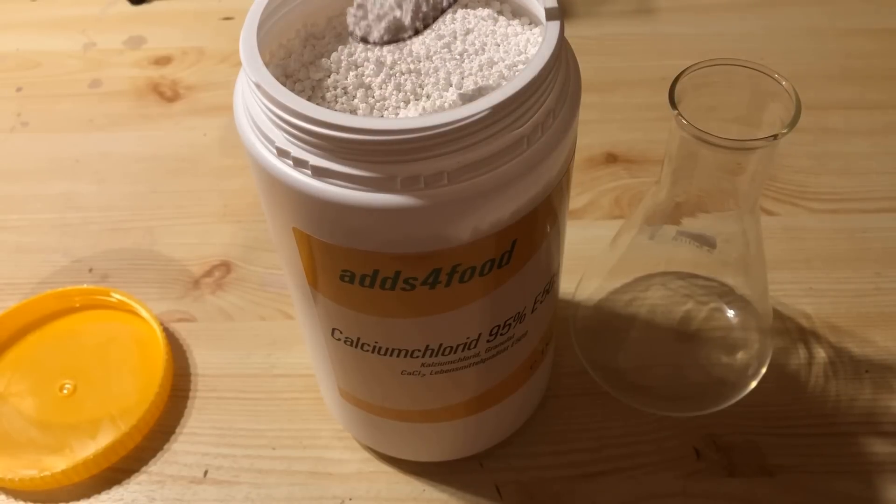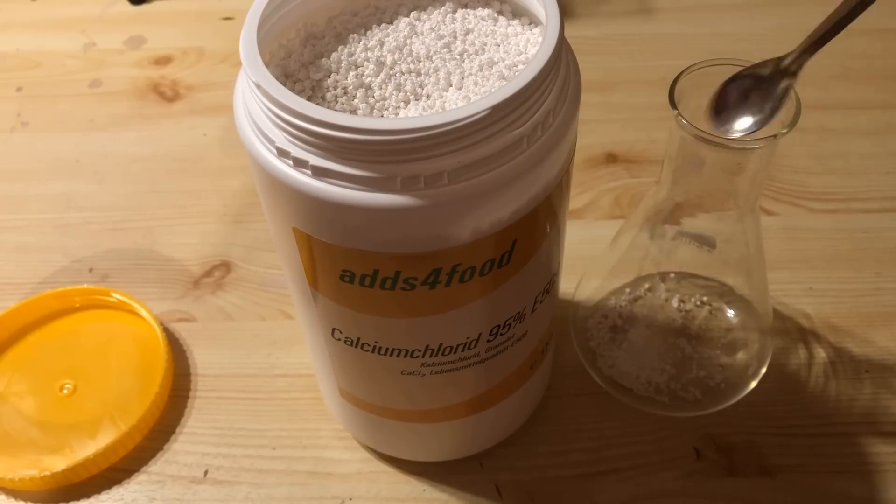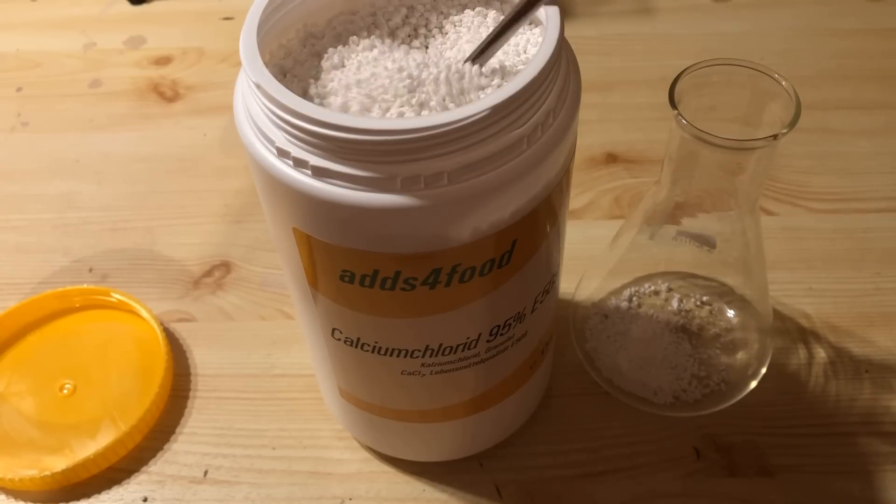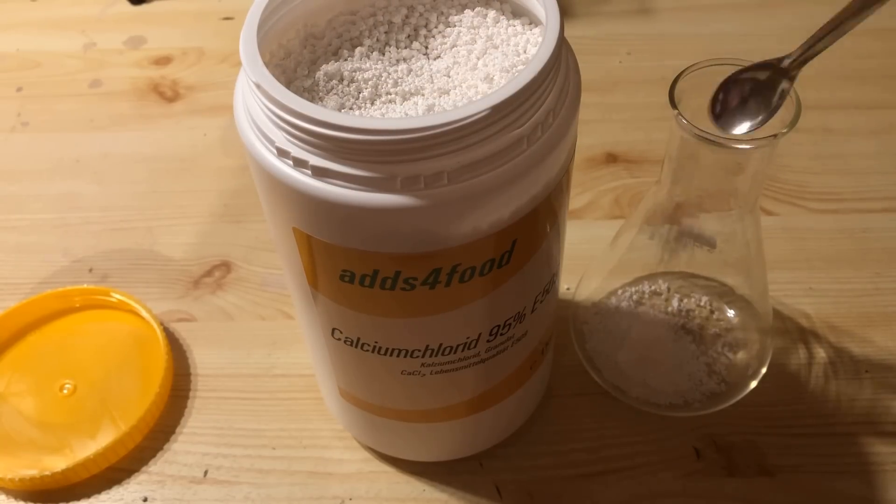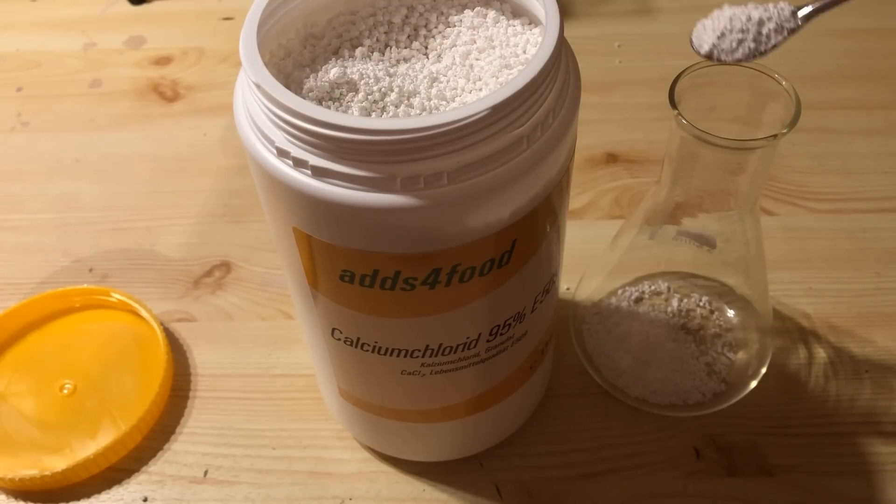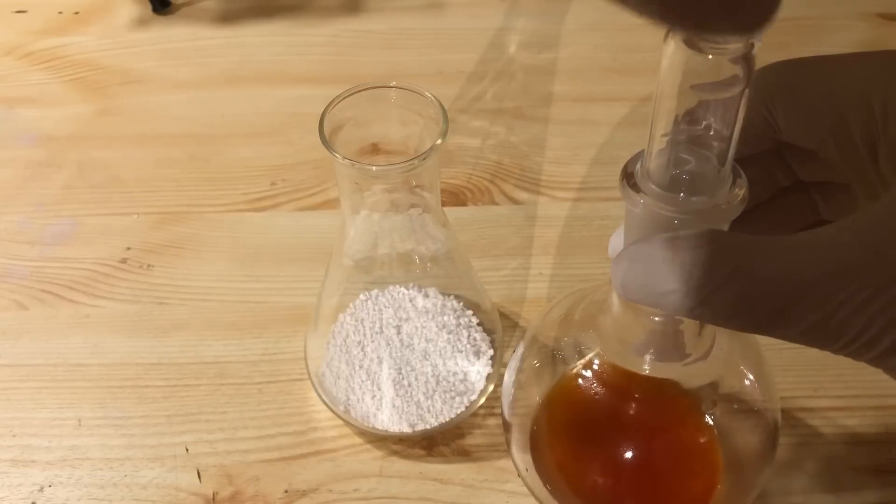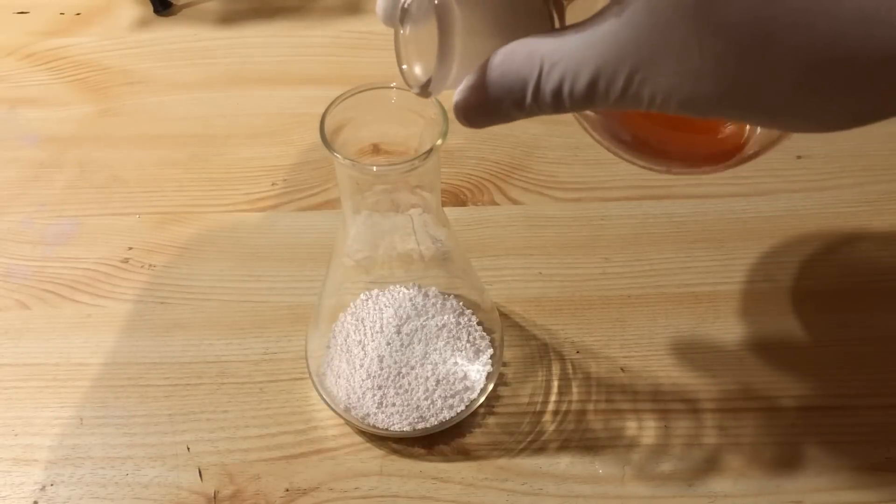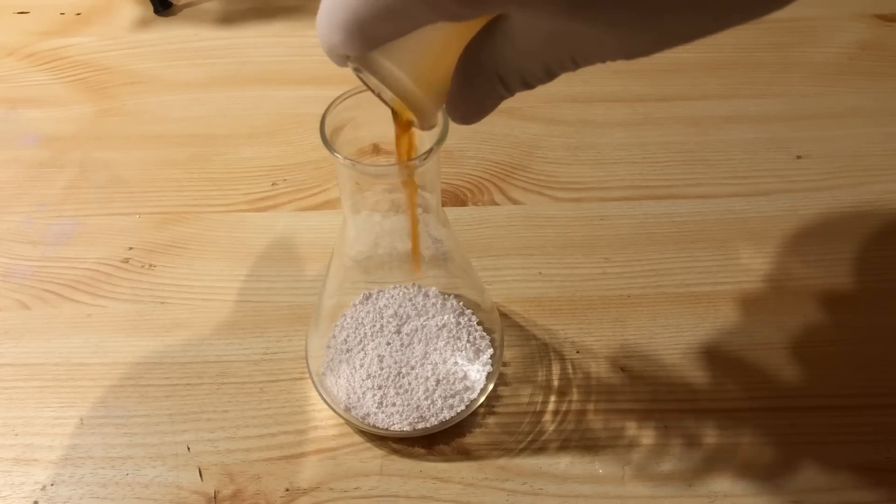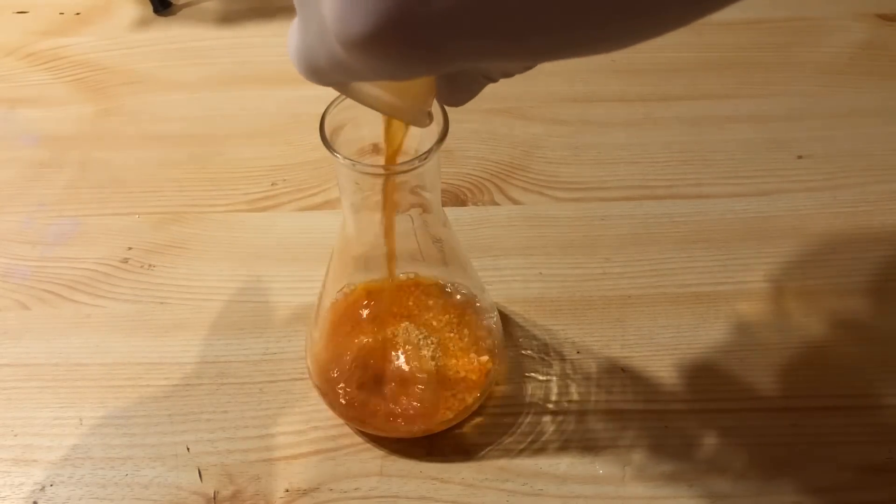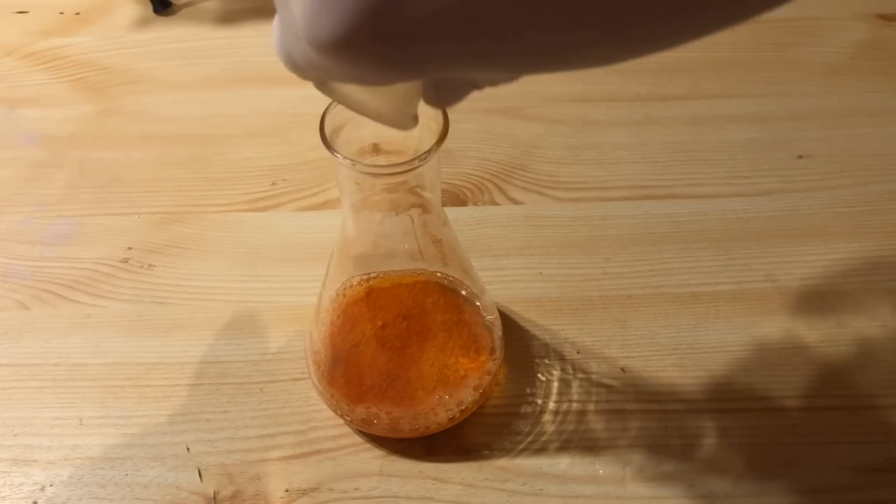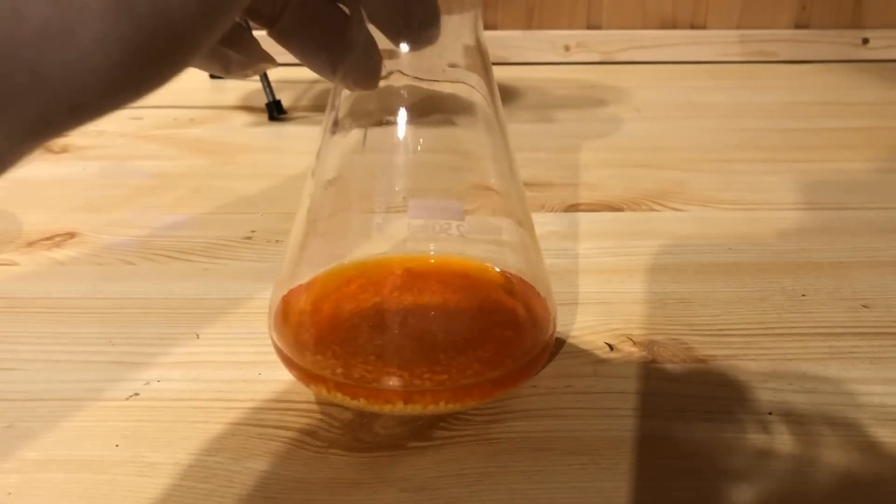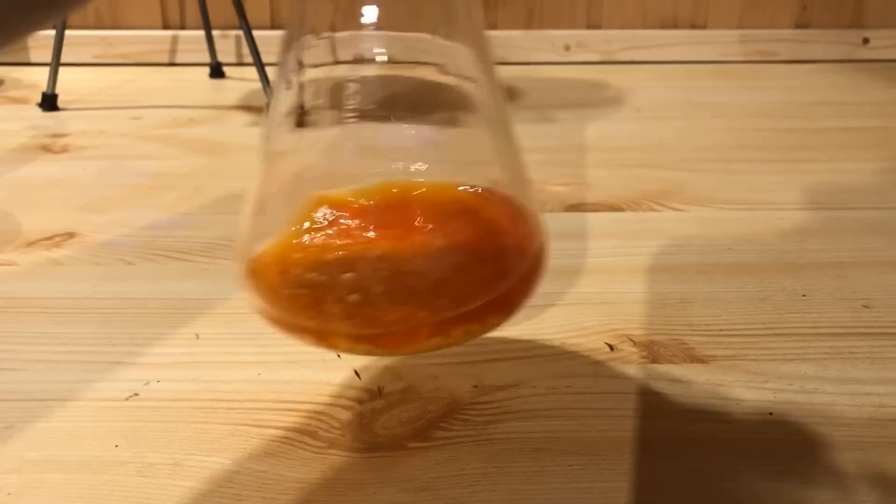Calcium chloride is used to get rid of the water in the distillate. The calcium chloride is allowed to sit with the crude benzene for a minimum of 1 hour.